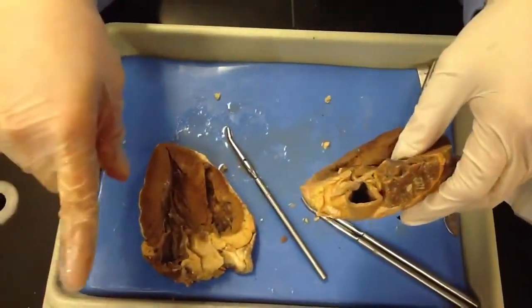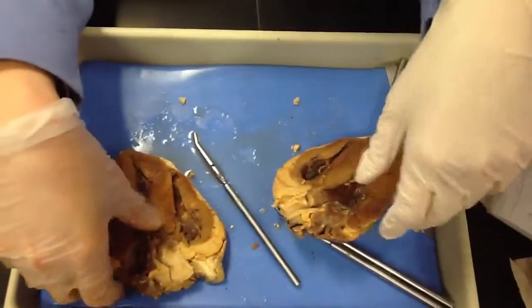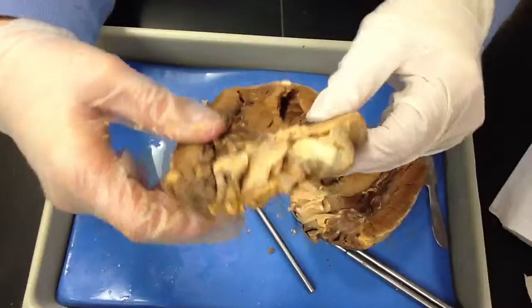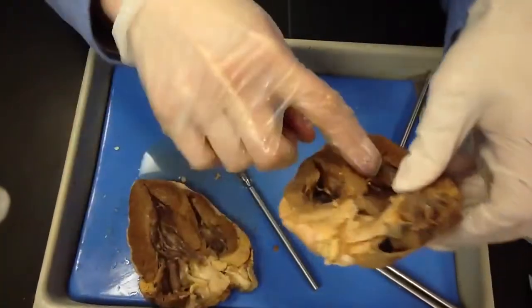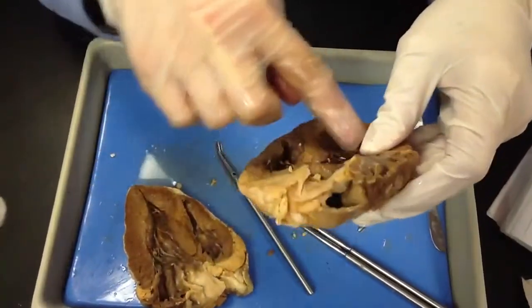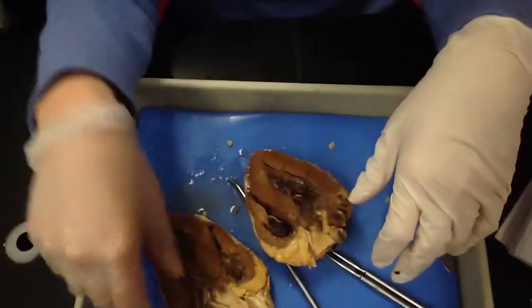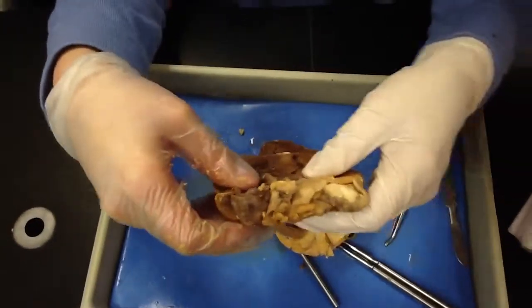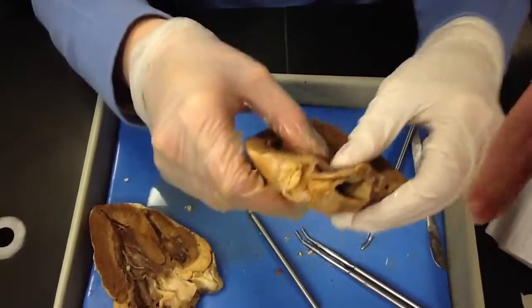It's going to get oxygenated. Then it's going to come back in through what? Pulmonary veins. Yeah. It's hard to locate, but this should be for your aorta right here. That's where your aorta should be. It's just how you cut it. Pulmonary vein is right here. Isn't that the pulmonary vein right here?